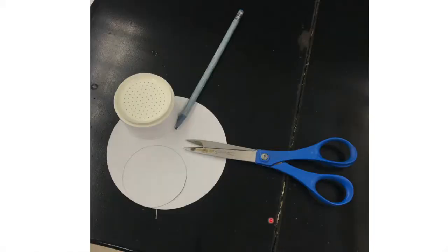While my crystallization solvent's cooling and I'm hopefully forming some nice pure benzoin crystals, I'm going to prepare for the vacuum filtration. So I take my Buchner funnel and I use a pencil, not a pen, to outline it, and I'm going to cut that out, the filter paper, to fit well inside of this so I can purify my crystallized benzoin away from the crystallization solvent, the mother liquor, and the impurities. So it's been about a half an hour cooling on here. It's looking like it's got some nice looking crystals coming in.